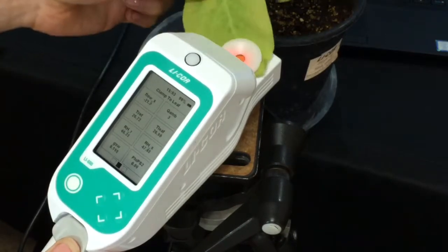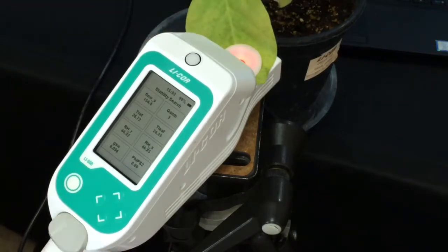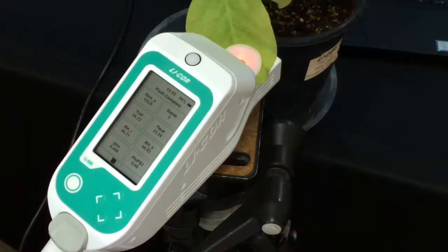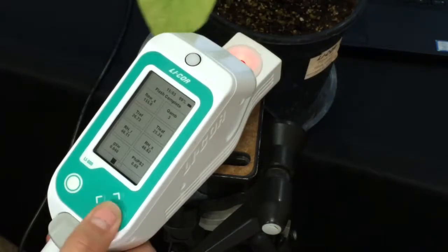We're ready to clamp onto a leaf, looking for stability. Okay, we'll unclamp.